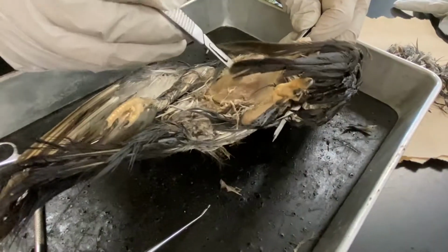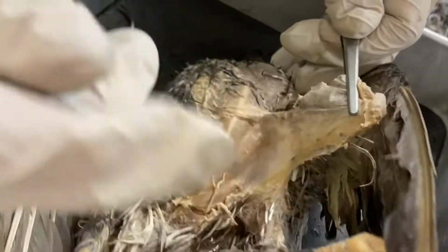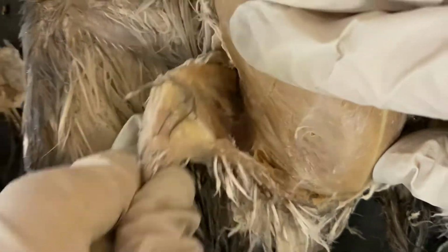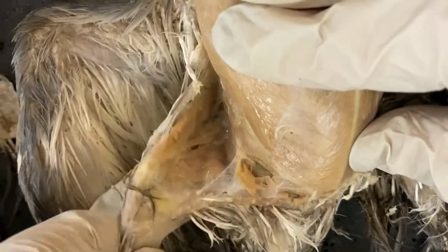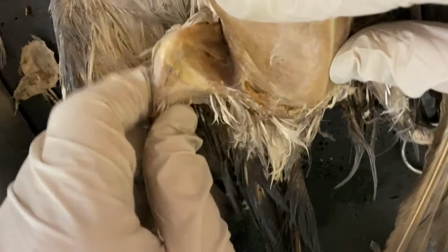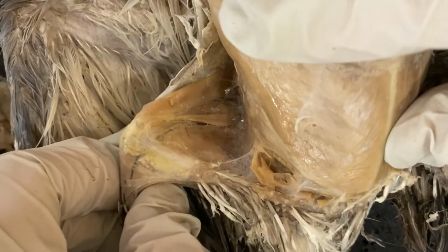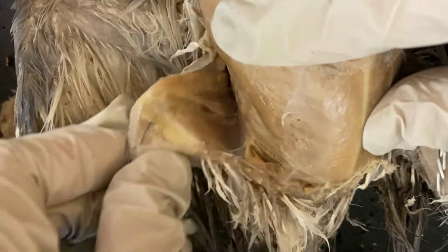So I'm peeling off the skin, and you can see this tissue here. This is connective tissue that holds the skin. So to get the skin off, we're going to cut that with a scalpel. Okay, I've pulled the skin off of the leg and lower abdominal area, and you can see the leg joint, the tibia. The femur is here, and the tibia is where I'm holding along the fibula. And the iliotibial muscle, ilio refers to the hip area, tibia refers to the lower leg, which is where I'm holding, and this big muscle here, which if you have chicken legs, that's mostly the meat that you're eating, and that is that muscle that we see moving there.